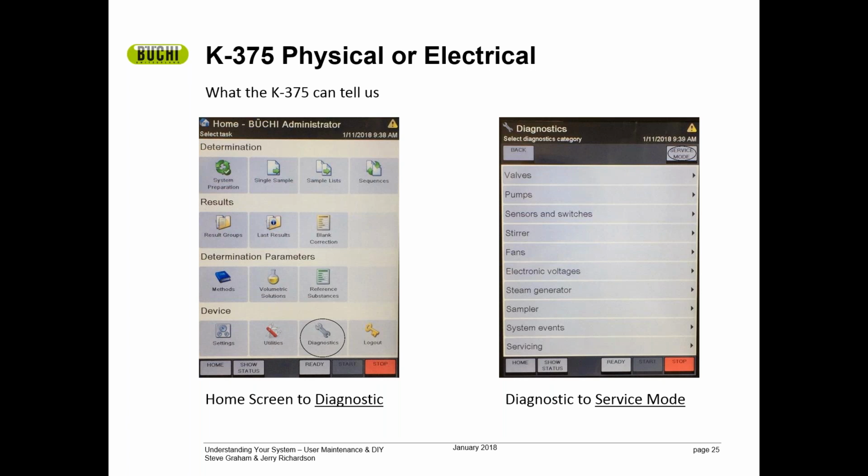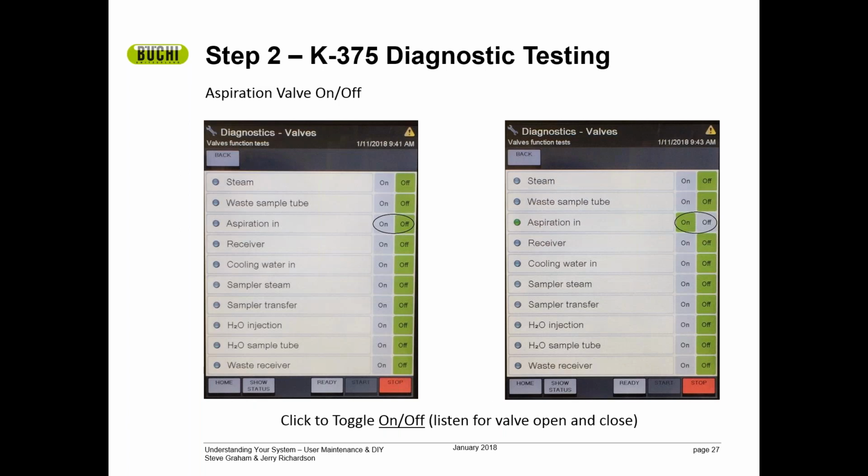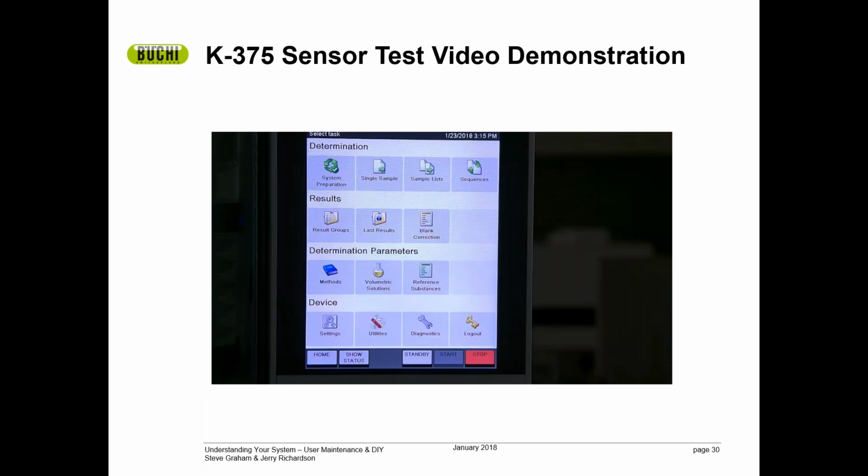If we go to the home screen, then we can go down to the diagnostic screen and go to the service mode. Now, the next few slides in this webinar are primarily for your reference in the future, because we did a video of actually running this so that you can see how the diagnostics works. So let's take a look at the actual video of running it.